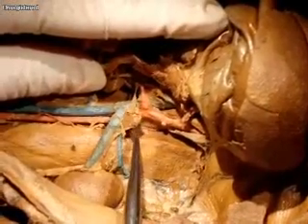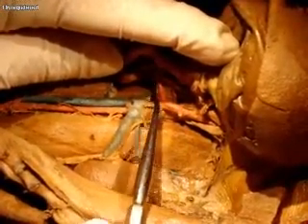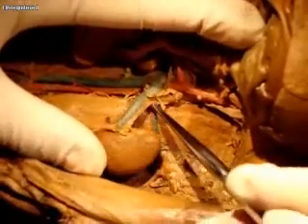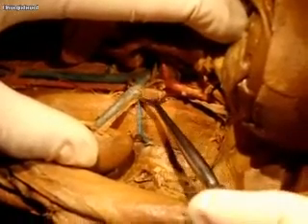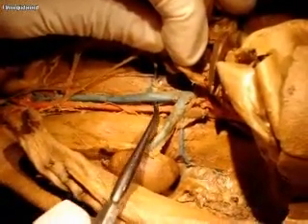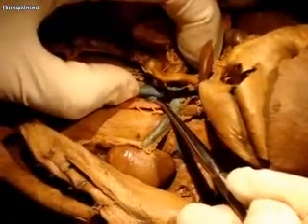Right next to that is the adrenal gland. And now this is your caudal vena cava — you can also call it inferior vena cava because there's only one of them here — branching to the renal vein and also the renal artery underneath it. Right where the adrenal gland is, there are two arteries and veins that come off and go right near the adrenal gland; these are called adrenal lumbar arteries and veins. There are also a couple of veins going straight back down — those would be lumbar veins.